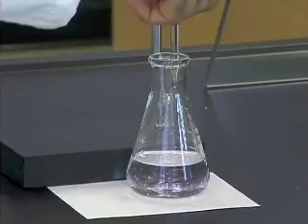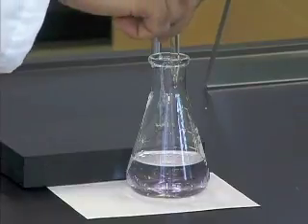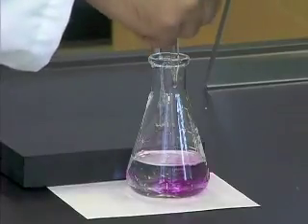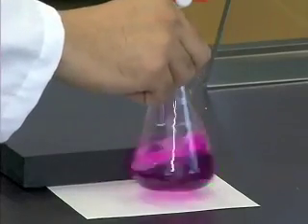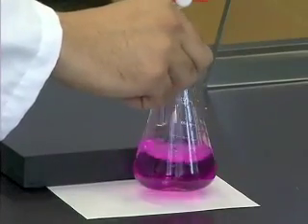In the case when you have fast addition of the titrant, you might overshoot the endpoint, which would then look something like this, containing an excess amount of the titrant. Now you know the proper way to do titrations. It is now time to clean up.